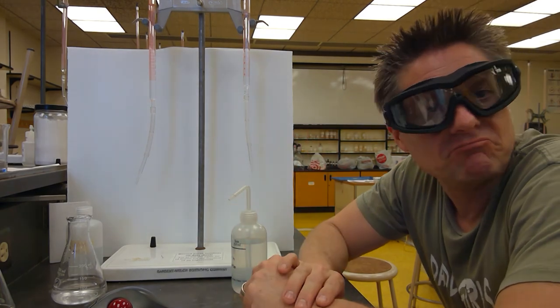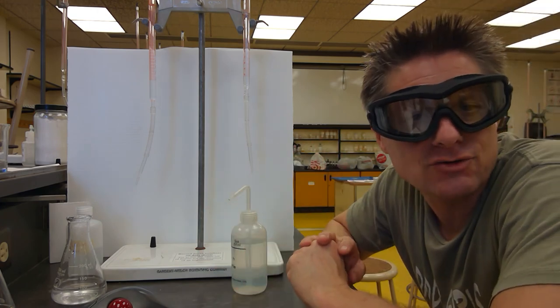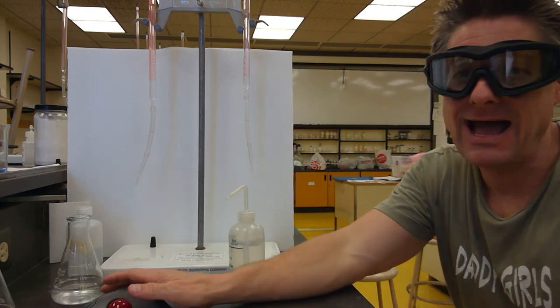And the calculations may be a little trickier, but with this technique, you're never worried about screwing it up. You never have to repeat the experiment. If you don't like your pink color, just back titrate some more. Piece of cake, guys. You got it.